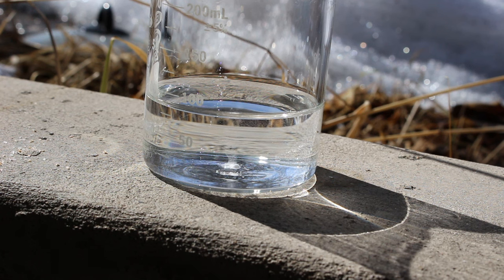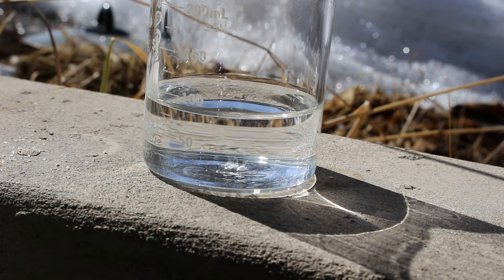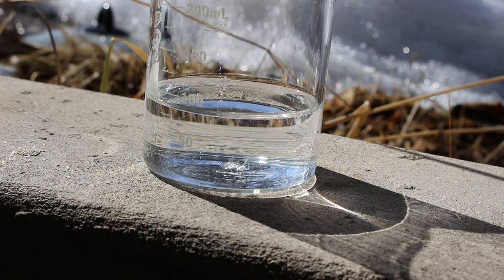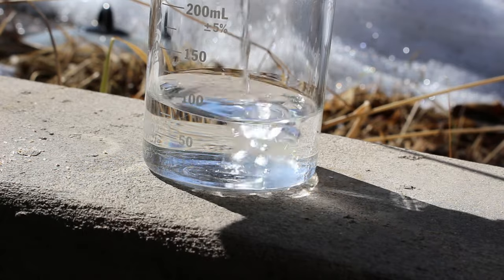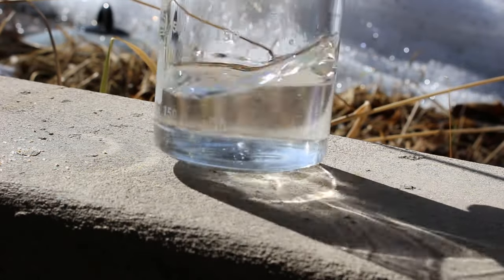That's mostly dissolved. Now in order to get the cyanide to dissolve the gold, it needs a source of oxygen. You could use the air, but that's fairly slow, especially if you're using a sealed container. So I'm going to splash in a little bit of hydrogen peroxide — that'll be my source of oxygen. This reaction actually produces hydrogen peroxide as an intermediate anyway, so this just speeds up the process. There's my gold dissolving solution.